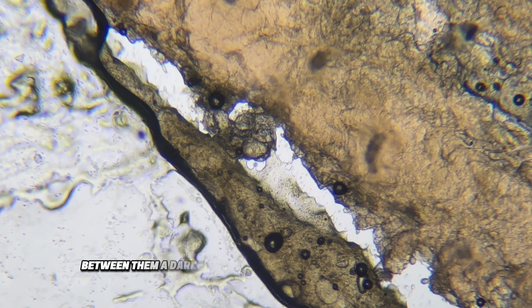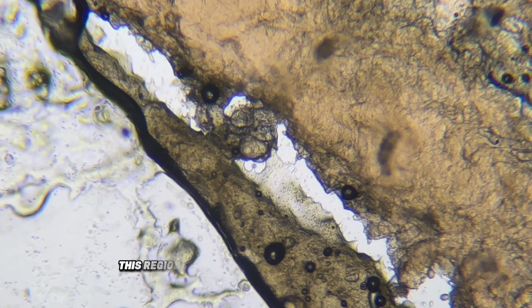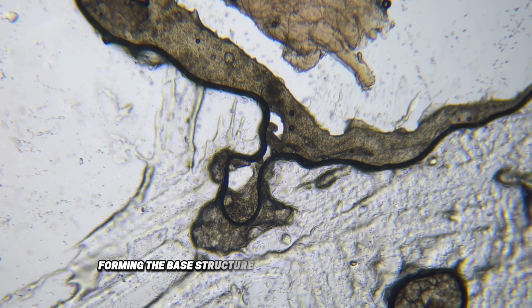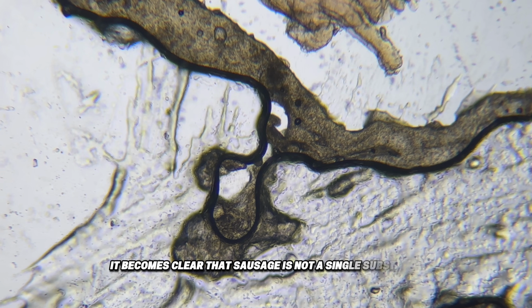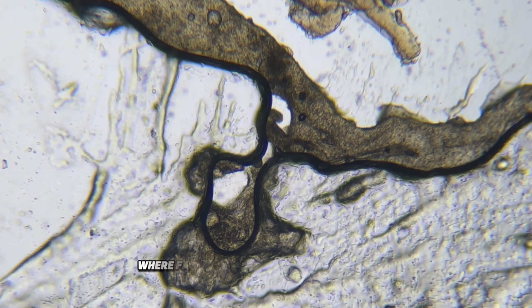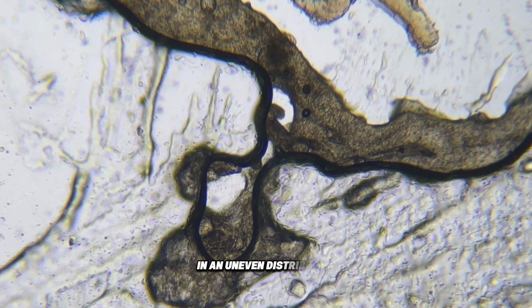Between them, a darker granular background dominates the image. This region consists of finely ground meat particles, forming the base structure that holds everything together. Even at this scale, it becomes clear that sausage is not a single substance. It is a mixture, a compact system where fat and protein-based material coexist in an uneven distribution.